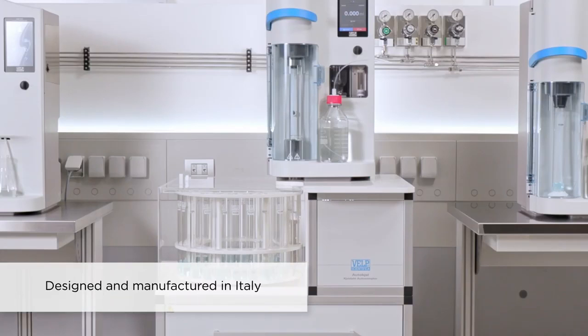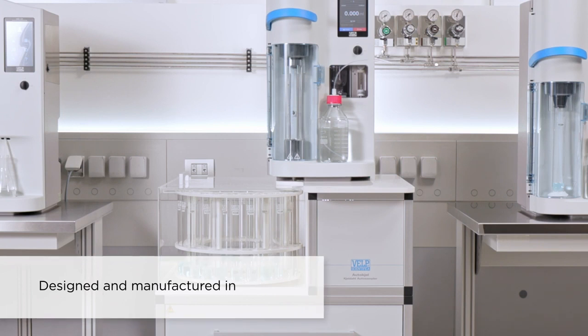VELP UDK169, the premium Kjeldahl Distillation Unit designed just for you.